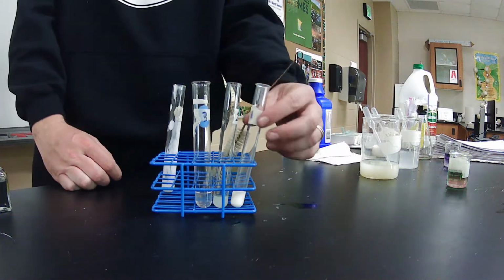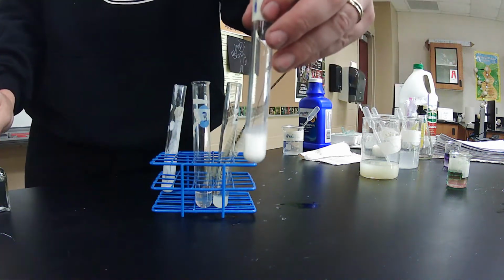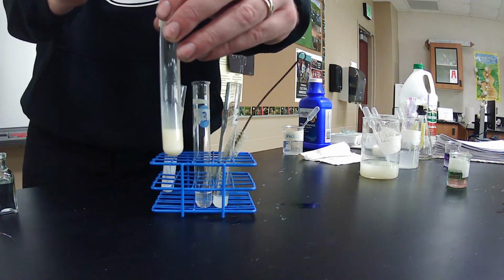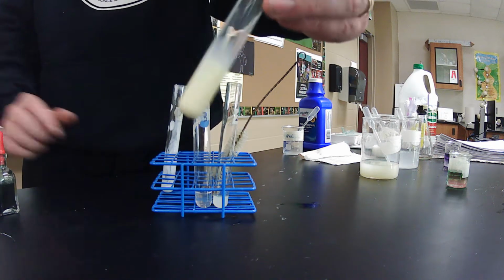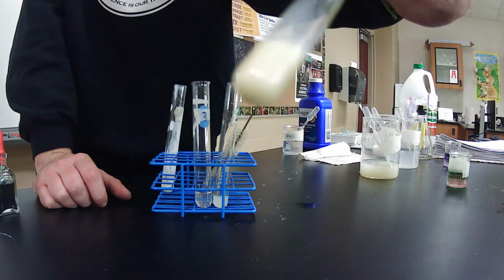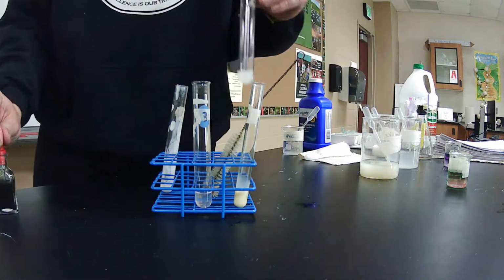Okay, so test tube number 1, just normal plain white milk. I'm going to add a couple drops to this. 1, 2. We'll give it a little stir. Drop a couple more drops in there. Shake it up a little bit. And it gives us this yellow. This yellowness we're going to come back to, so we can compare different things. So that's our milk.